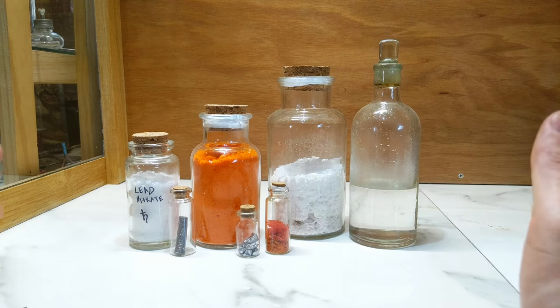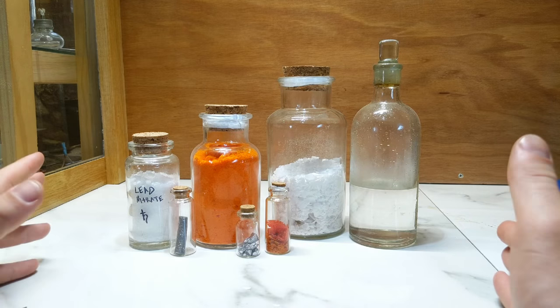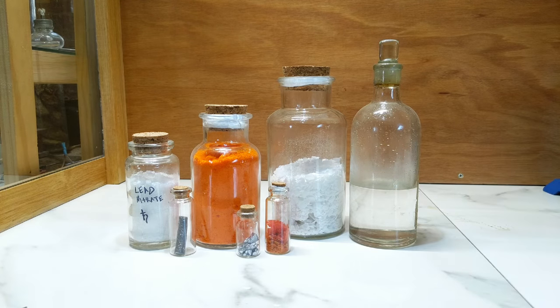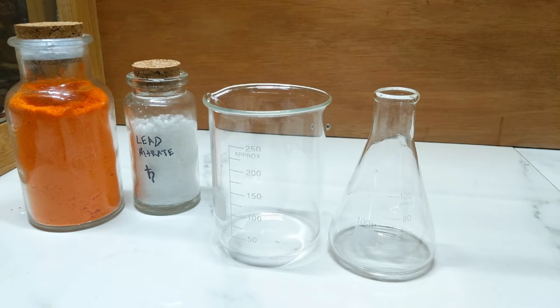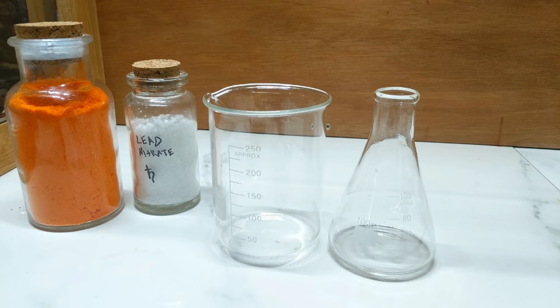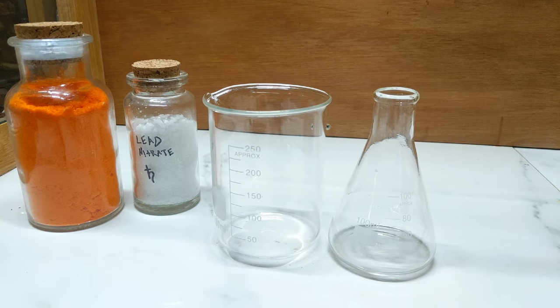So let's just start by getting a very simple neutral lead chromate produced, and then we'll work from there. So now I'm going to mix up my lead nitrate solution and my potassium dichromate solution so I can make the first precipitate of lead chromate, which will just be my neutral lead chromate yellow.